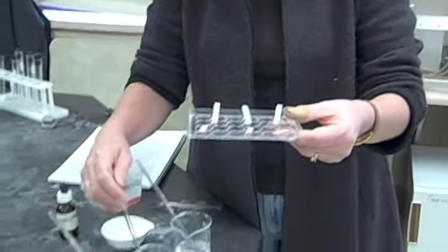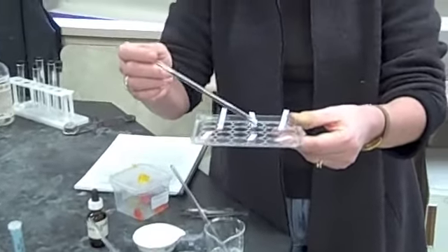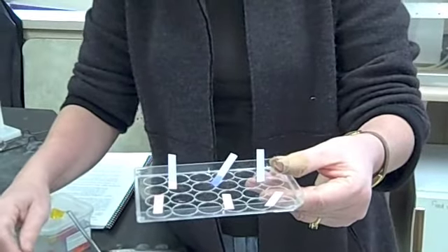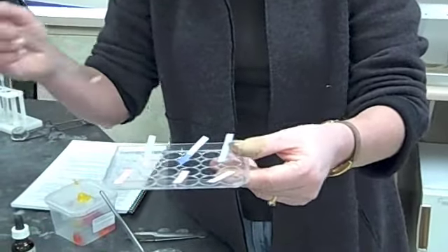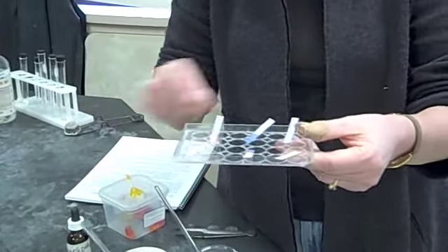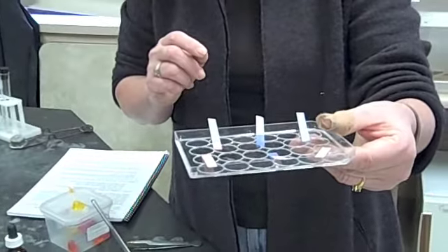Let's try this second one. I'm going to put this second one and just touch a drop to the blue litmus and it stays blue. Can't determine anything yet. Now I'm going to use that same liquid and touch the stirring rod to the red litmus. And do you see that it's turned blue and remember blue be base.